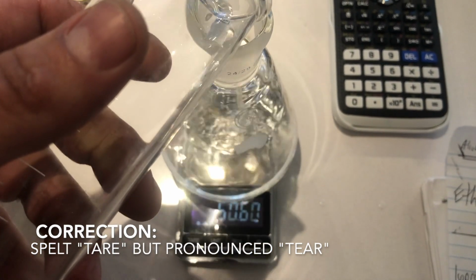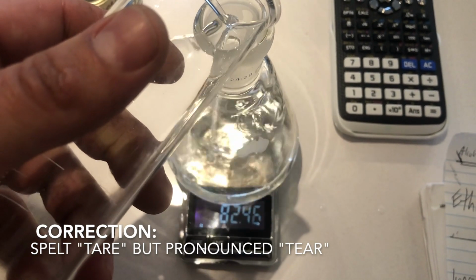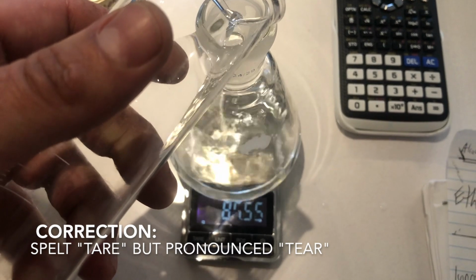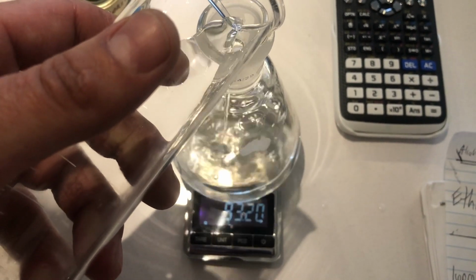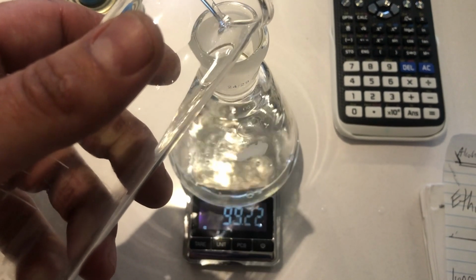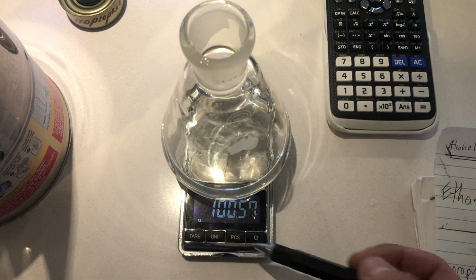Now, of course, we could use the measuring cylinder to measure the amount of water. Unfortunately, I felt it more accurate to measure the water by its mass. Well, fortunately, not unfortunate. So we'll go for a nice round value, maybe 100, and we got as close as possible. And we'll record those decimals.